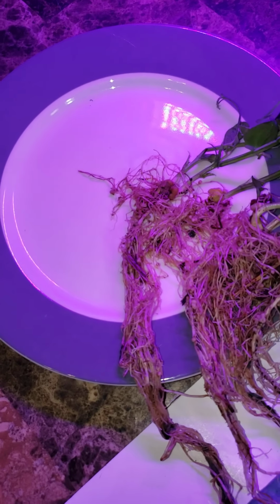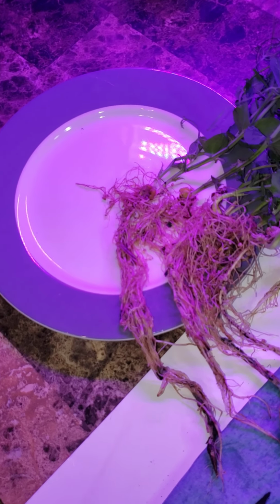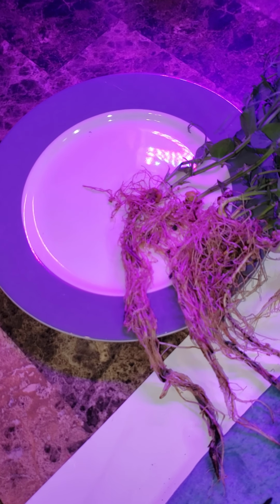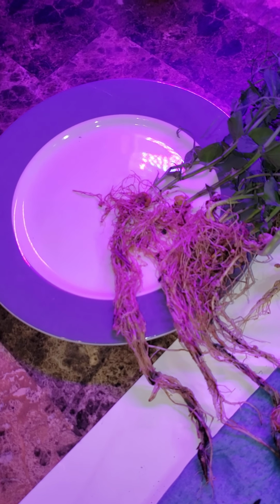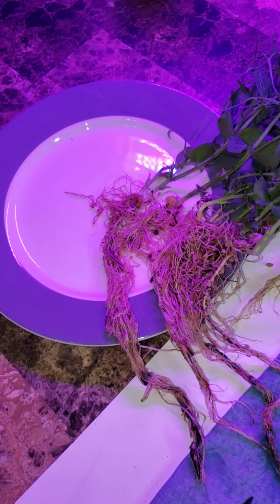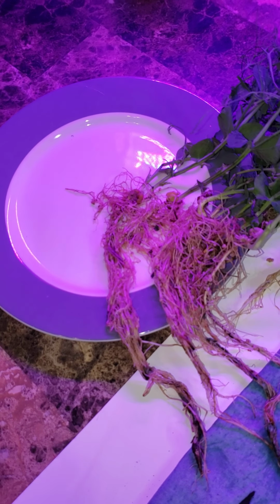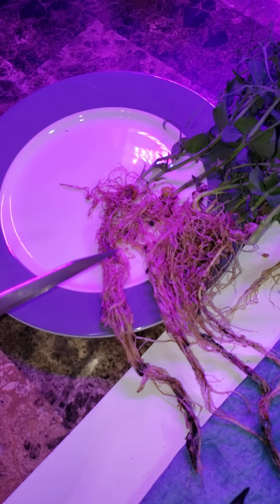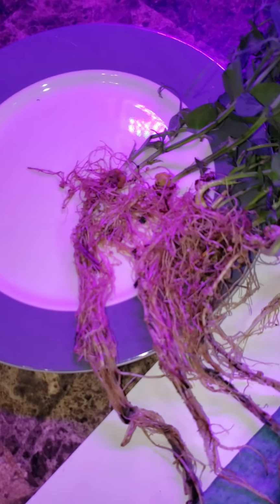If the interior of the nodule is white or greenish, that's indicative of a non-active nodule in terms of nitrogen fixation. Folks, the nitrogen fixation that occurs in those nodules will typically allow the legume plant to obtain as much as 70, 80%, sometimes even more, of its nitrogen from the air through biological fixation by the activity of that rhizobium bacteria contained in that nodule on the roots.